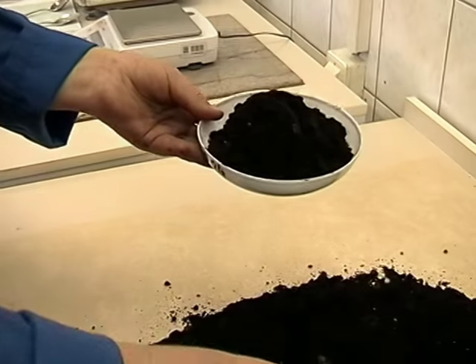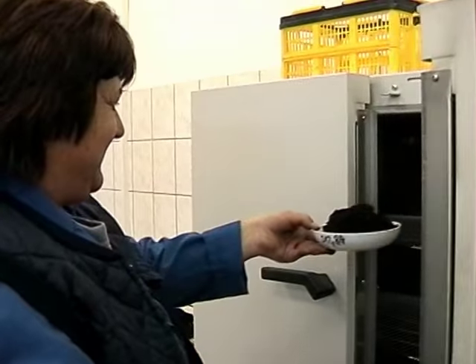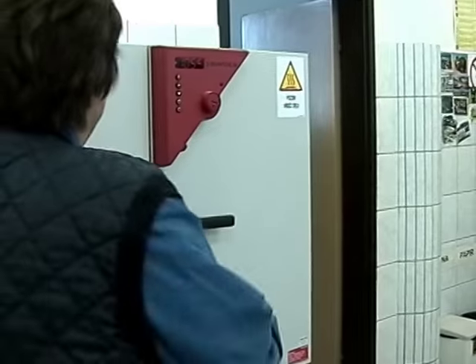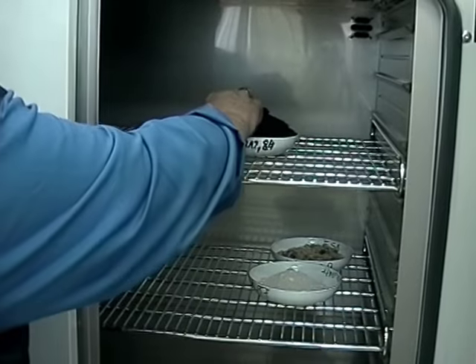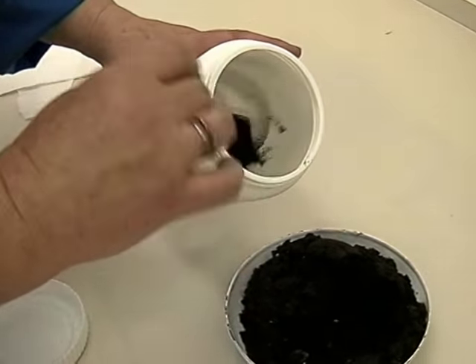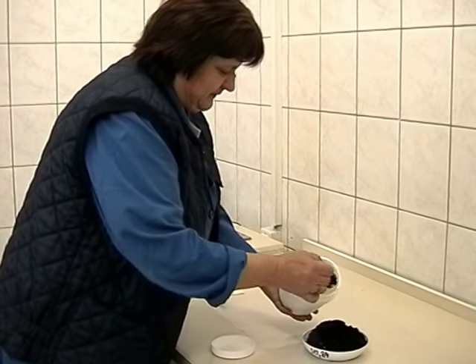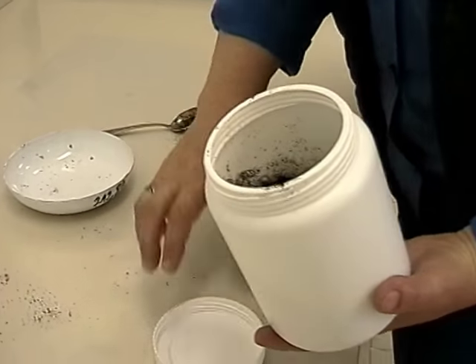Topsoil, like many organic products, contains variable amounts of water. Therefore, the sample is dried in an oven at 105 degrees Celsius. During this process, water and other volatiles evaporate, and the sample mass is reduced. It is critical that everybody does this at a certain agreed temperature and for an agreed period of time; else, there can be no comparability of the results. In other words, the measurand is actually defined by the measurement procedure, a situation that often occurs in chemical measurements.